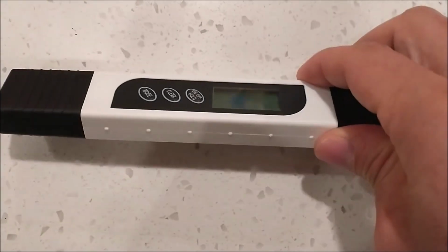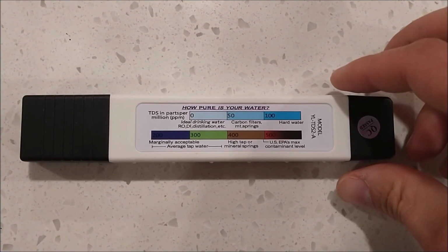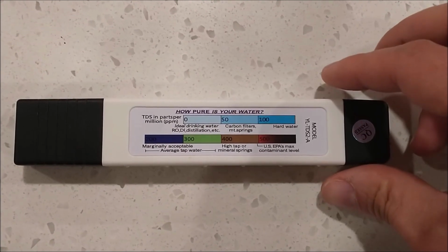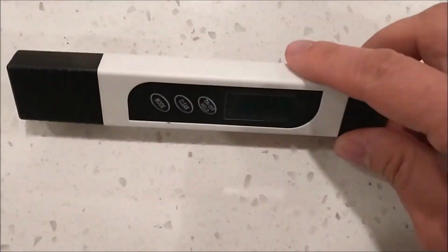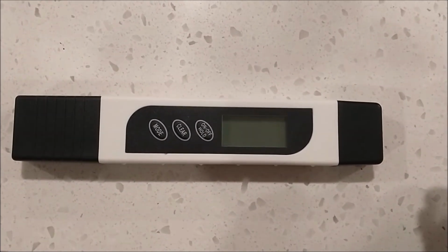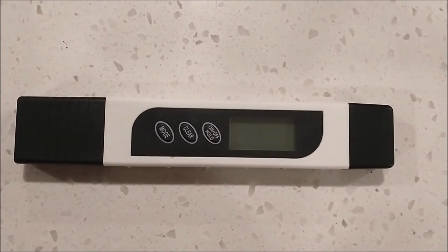Yeah, I got this water testing device. I'm going to test different waters. First, I'm going to find out the difference between osmosis drinking water and the rainwater, which one is better, which one is pure. And then I'm going to test the tap water from the city versus the AC water that came from the condensation of the air conditioner. So we'll see which one is the worst. All right, let's do the test.